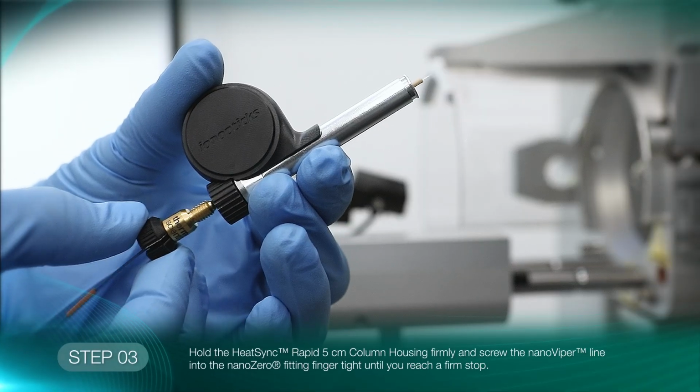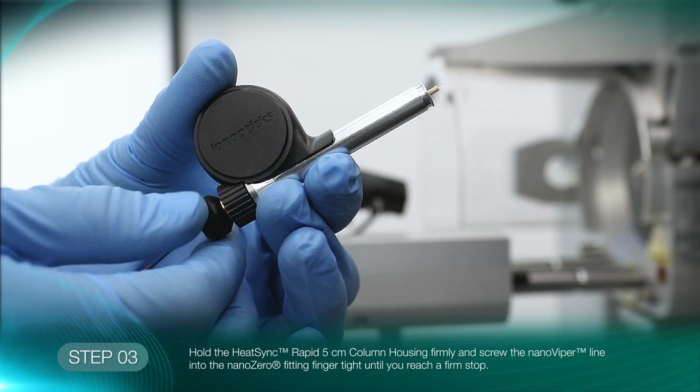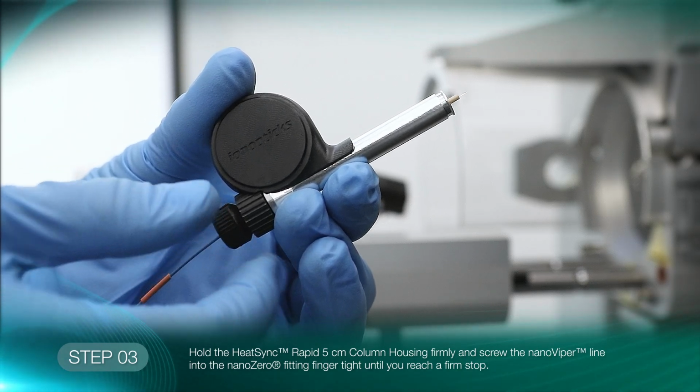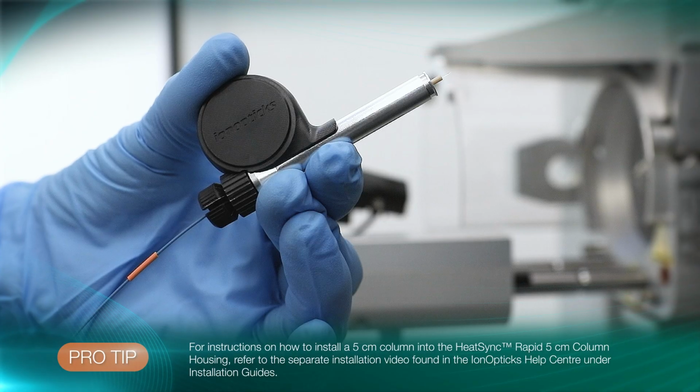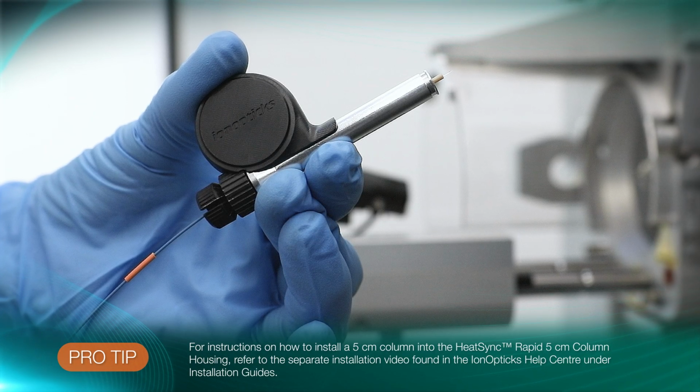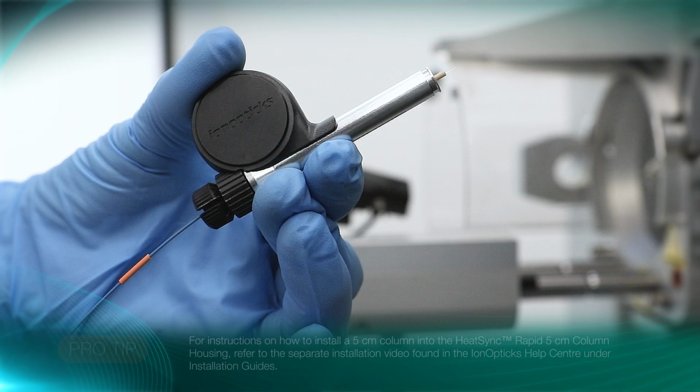With the 5 cm column pre-installed, hold the HeatSync column housing firmly and screw the Nano Viper line into the Nano Zero fitting finger tight until you reach a firm stop. For instructions on how to install a 5 cm column into the HeatSync housing, refer to the separate installation video in the IonOpticks Help Center.